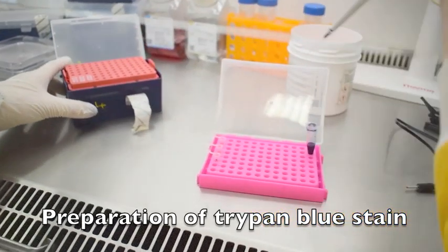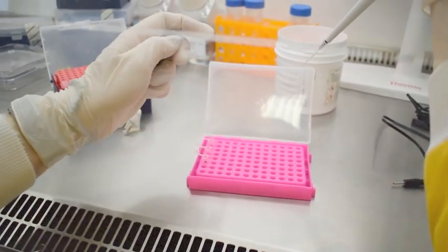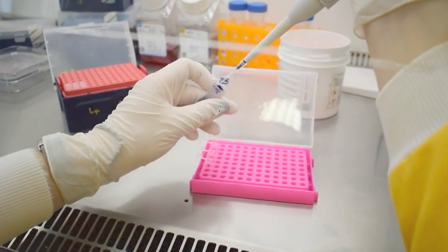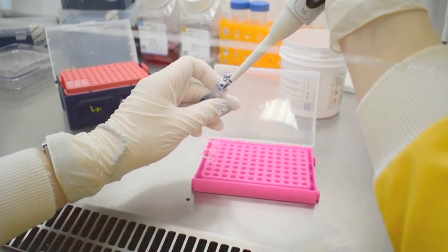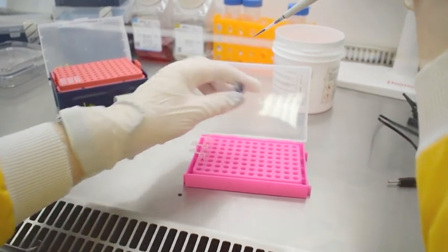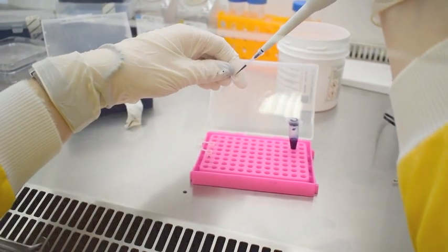Trypan blue solution is prepared to count the number of live and dead cells within the cell population. Trypan blue is mixed with cell suspension in a 1 to 1 ratio.